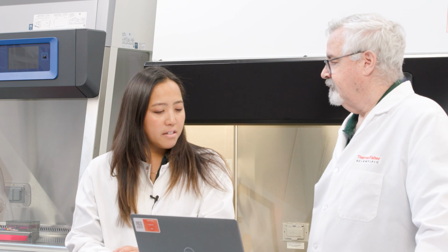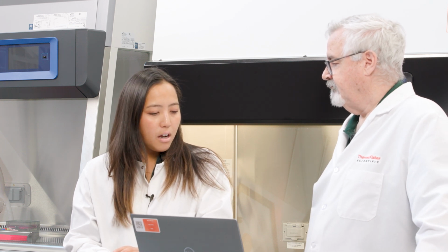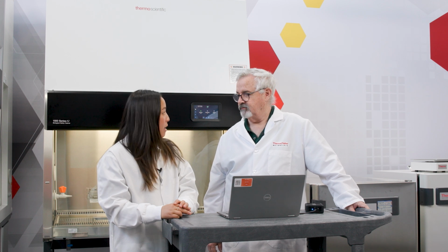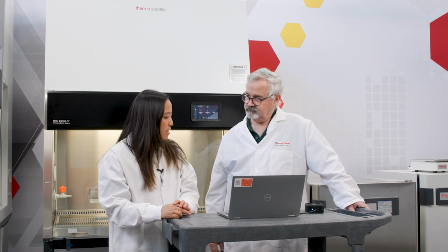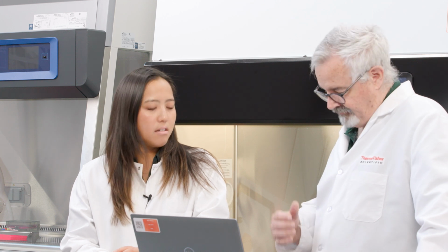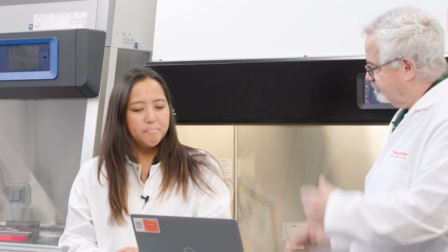Knowing the alarm statuses can be really helpful. The BSC operator can, of course, hear and see the alarm when it happens, but an overall record could help the lab manager identify areas that need more attention and are seeing more risk. Absolutely. Well, there we have it. We're done.